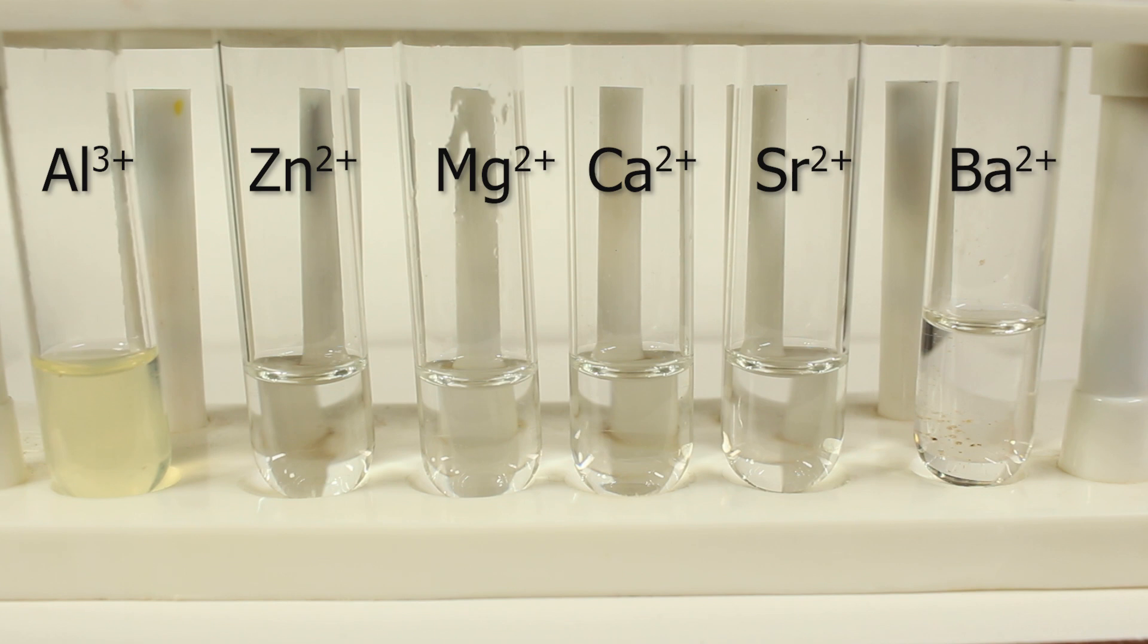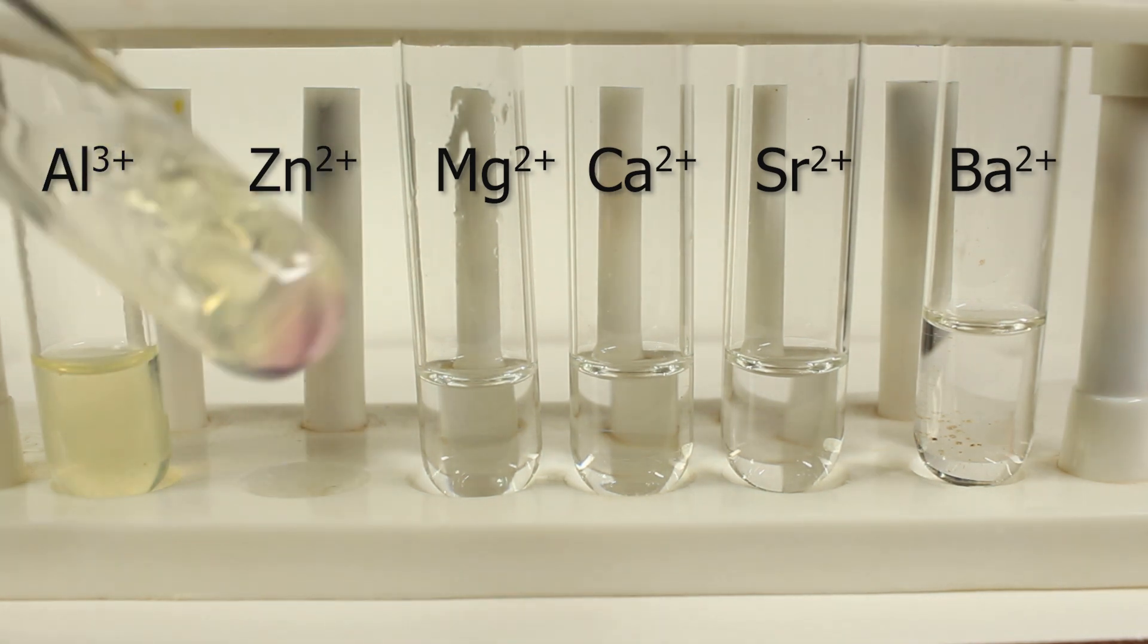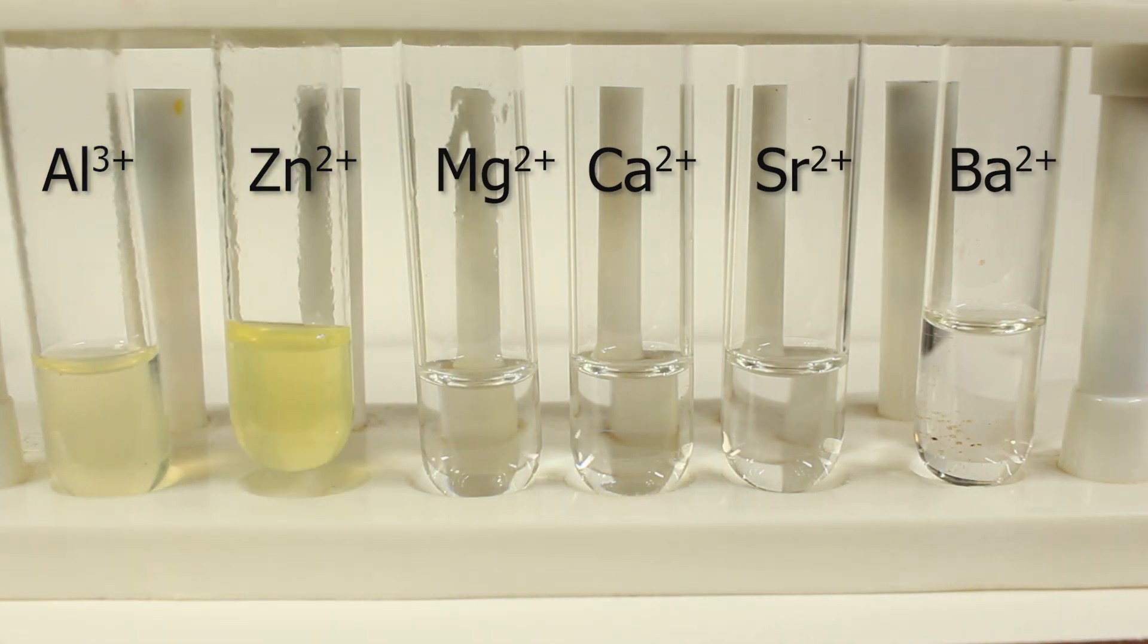Zinc hydroxide also I expect the same. Yellowish color. Maybe the complex is formed. Maybe it's just because of the change of pH.